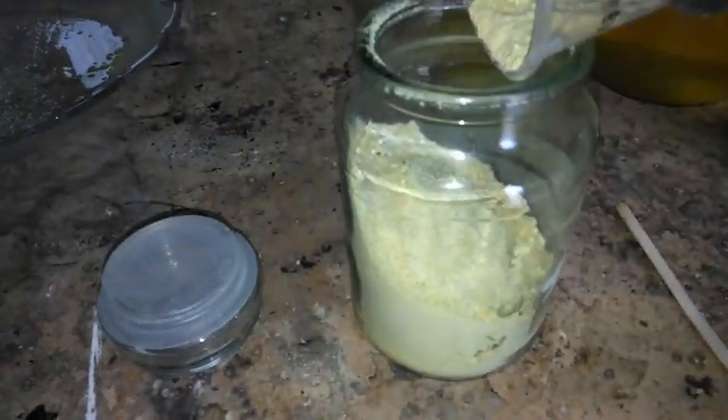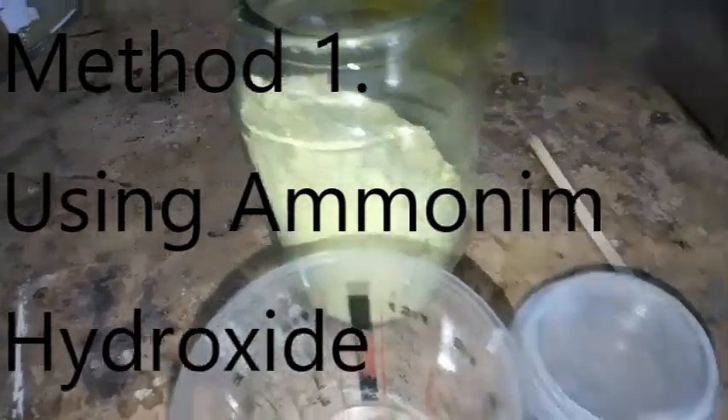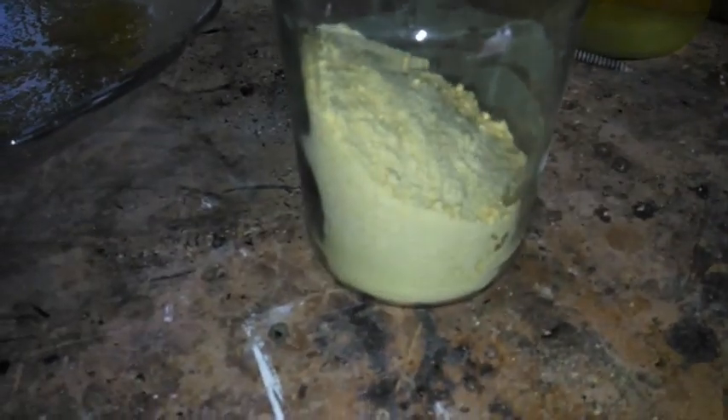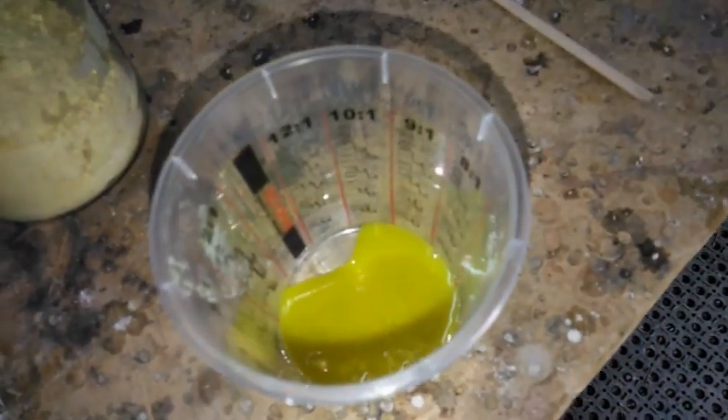Too much for this experiment anyway. By the way, these salts are highly hygroscopic — that's important to remember — and that just means that they love water. So here's my saturated solution. I'll just wait till it all dissolves and we'll put it in a little beaker type thing.